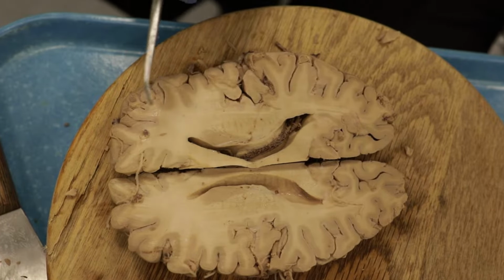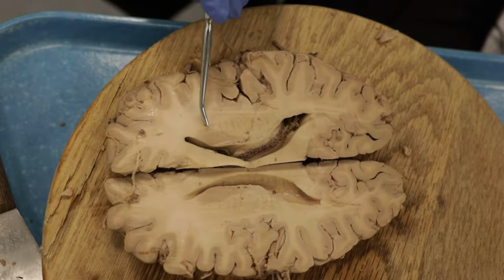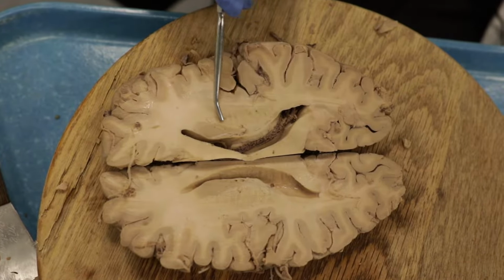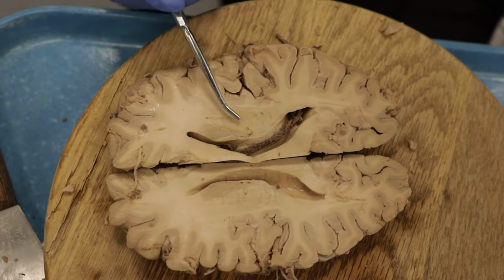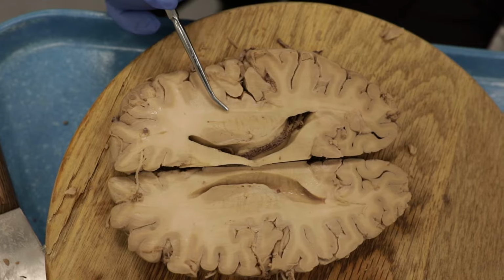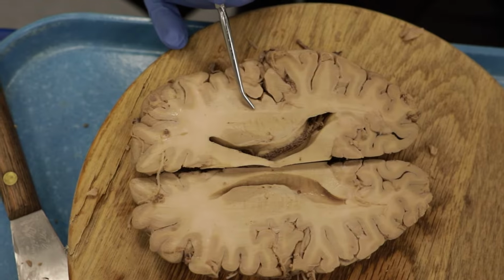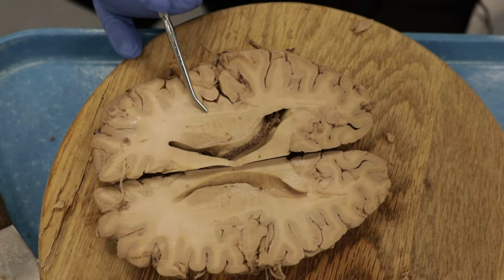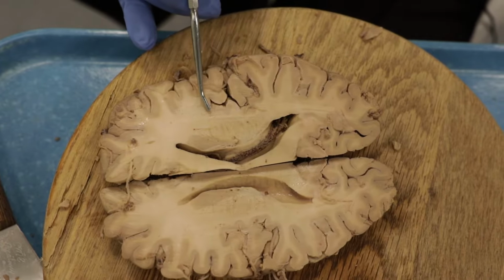We can see there is some white matter out here lateral to the caudate nucleus, and in our next cut, we'll see nicely the internal capsule and the different portions of the internal capsule. I'm going to point those out later, but as we move out here, we can see there's another little ribbon of white matter. This is called the external capsule. There's a little bit of gray matter right there. It's rather faint. This is the claustrum. And then we have another ribbon of white matter right here, and this is the extreme capsule.